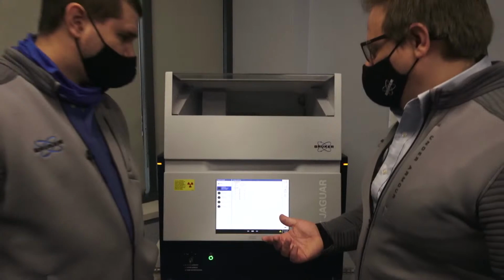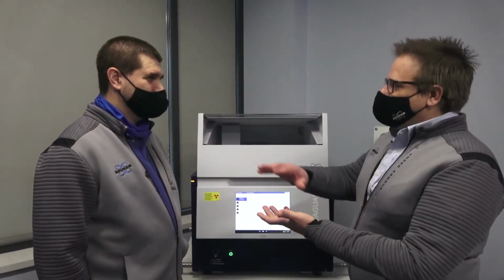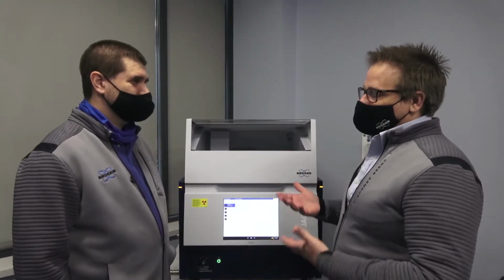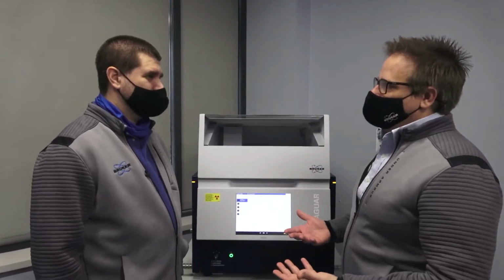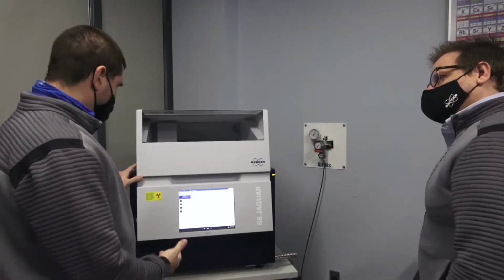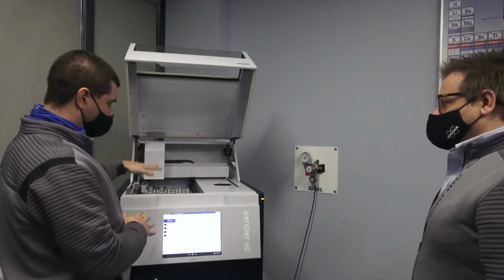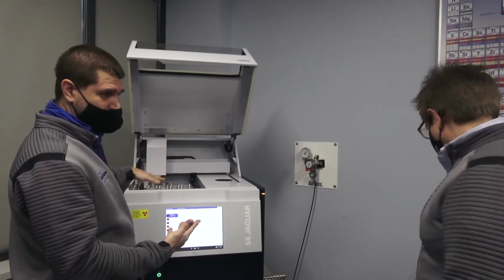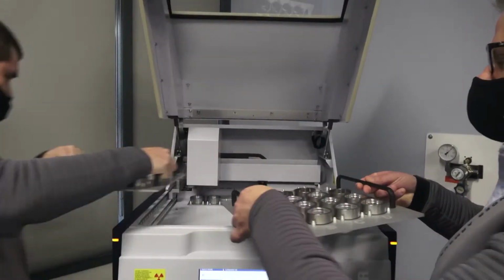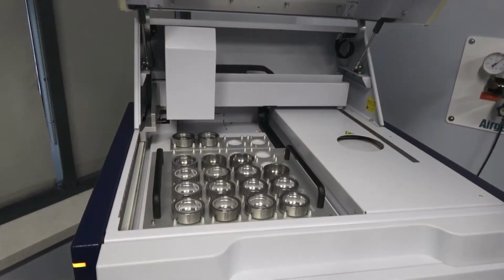So Dan, actually, before I joined Bruker, I worked in a steel place, and we used to have a whole bunch of samples, right? Because you have different customer batches, different alloys, and I would have to check them all at once. Is there a way to kind of load up a bunch of samples at one time? Yeah. So if you have say 20 samples, and you have this tray completely filled, and after you're done running, you want to load another 20 samples, you can grab another tray, which we have right there. You can take this tray right out, and you can load your next batch right in.